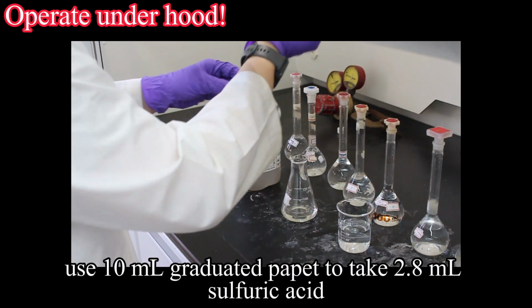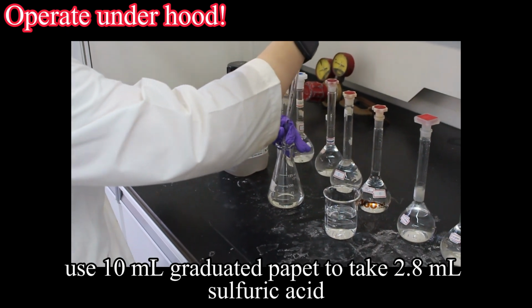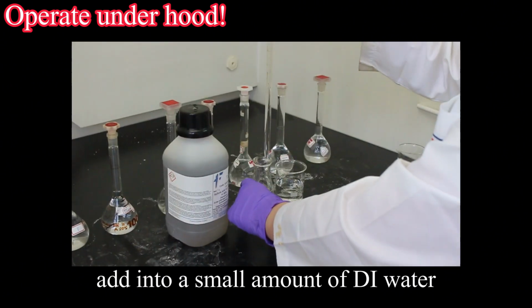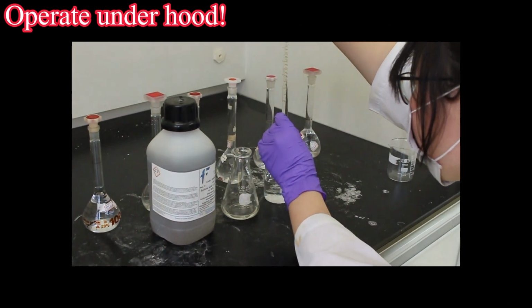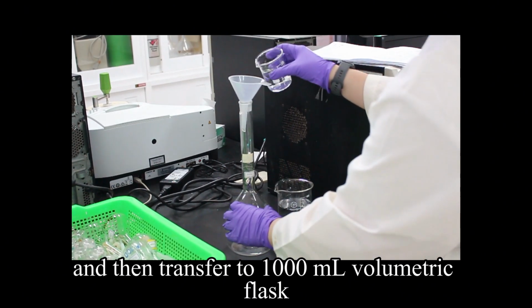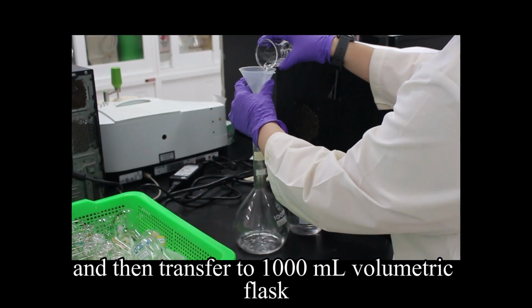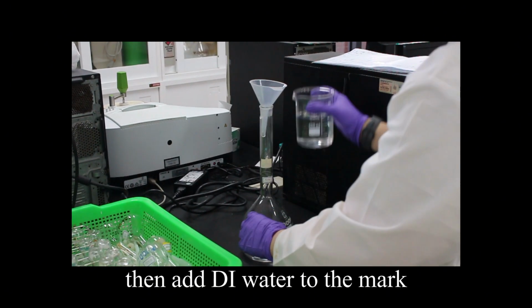Use a 10 ml graduated pipette to take 2.8 ml sulfuric acid. Add it into a small amount of deionized water, and then transfer to a 1000 ml volumetric flask. Then add deionized water to the mark.